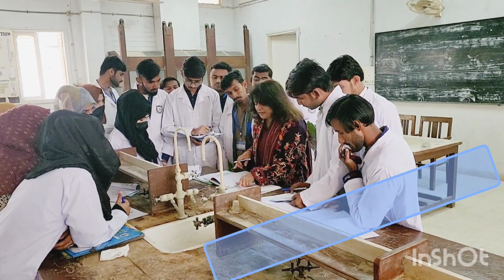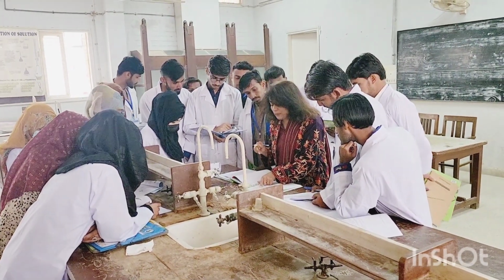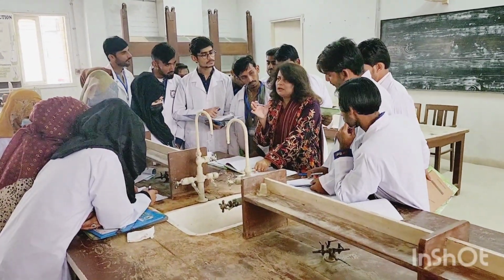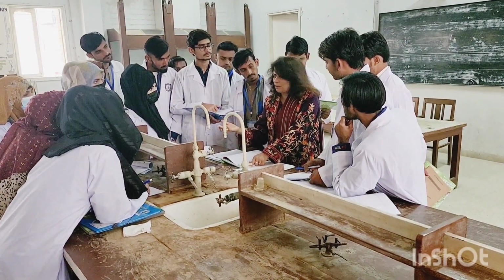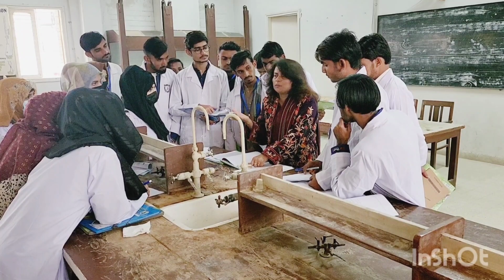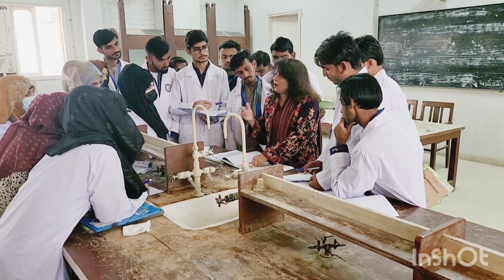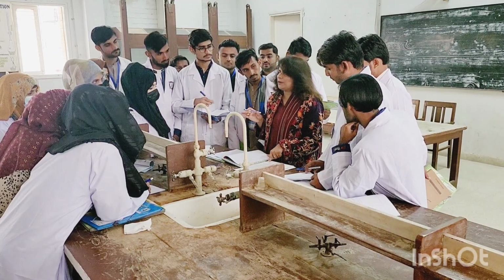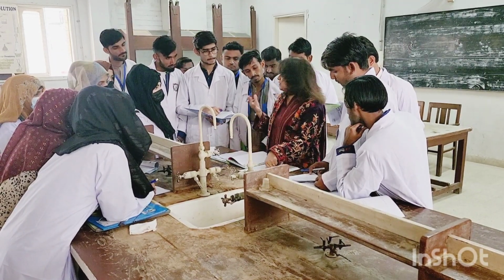Now here, something is missing. When you first select the first option for the physical state, solid, they have not written "may be present." You have to write down "may be present." Why am I adding this? Because right now, I will tell you the name of the compound. It's a known compound. I'm going to hand it over to you. But after that, in a few weeks, you will be having an unknown compound, and you won't be able to understand which compound this is. So you are not sure: may be present. You will add "may be present" in every sentence you are going to write down here in the inference, because we are right now in the very initial stage.